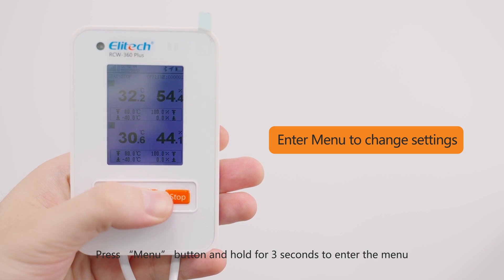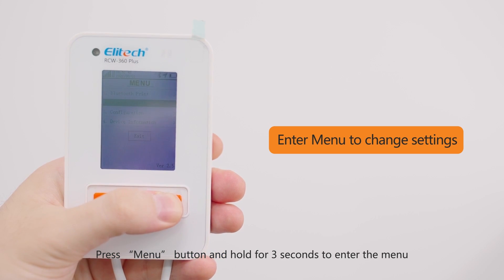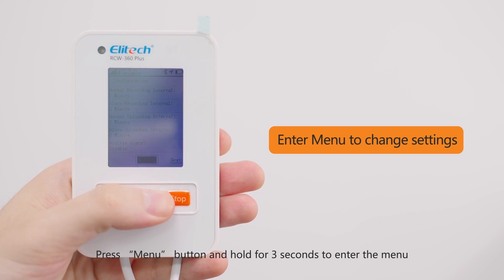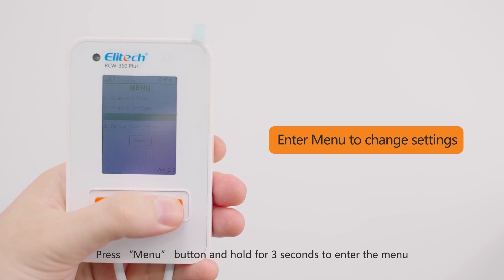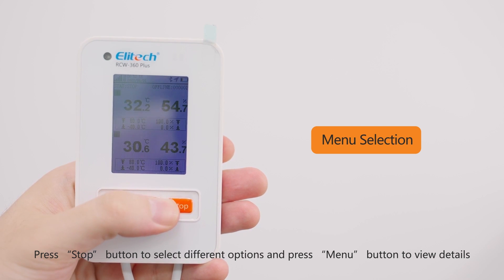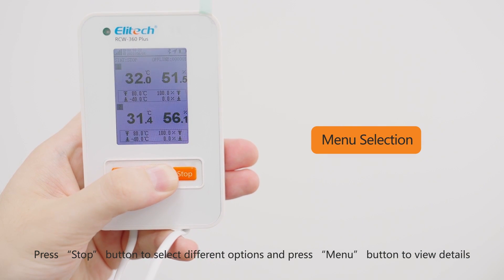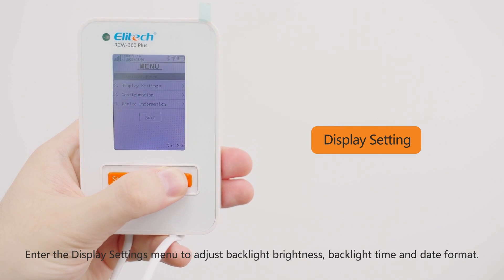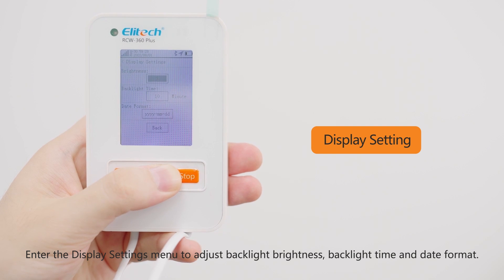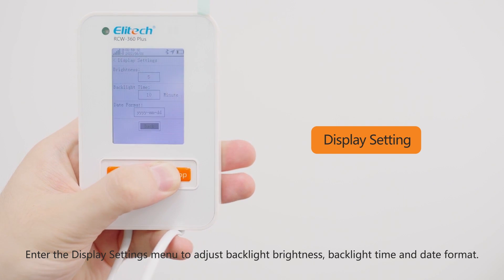Press and hold the menu button for 3 seconds to enter the menu. Press the stop button to select different options and press the menu button to view details. Enter the display settings menu to adjust backlight brightness, backlight time, and date format.